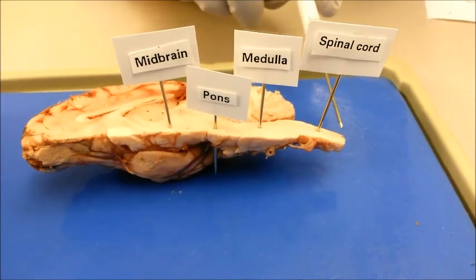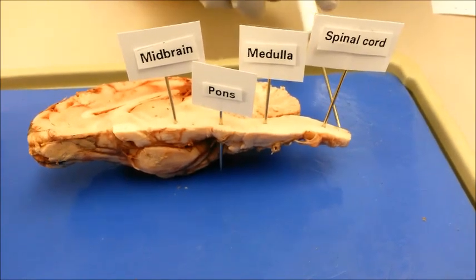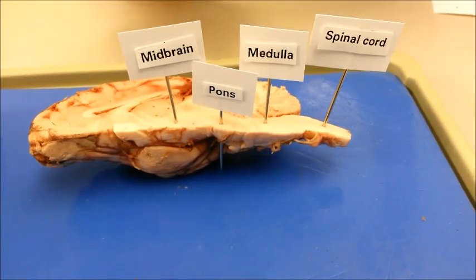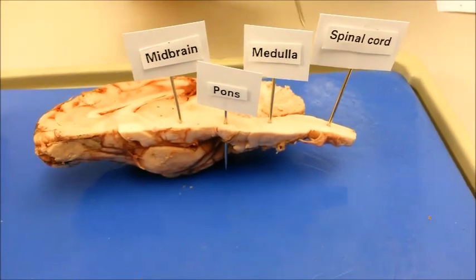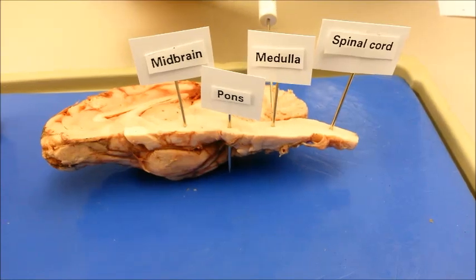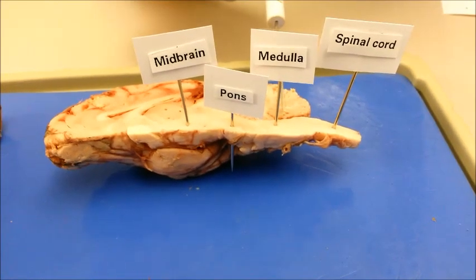The spinal cord is the connection between the brain and the body. Its main job is to send information to and from the brain. The medulla oblongata controls involuntary actions such as the heart rate and breathing. It also relays nerve signals between the brain and spinal cord.